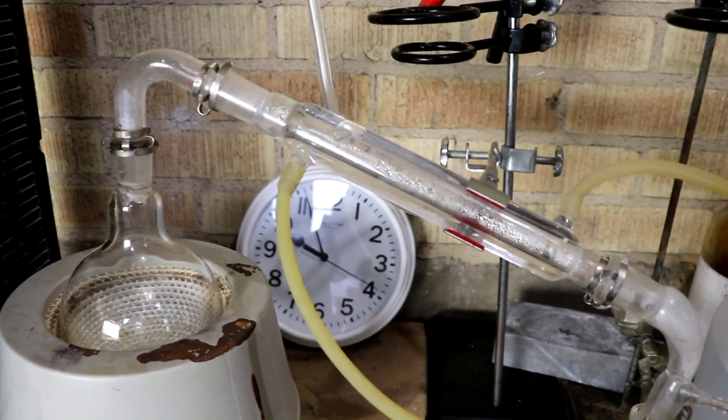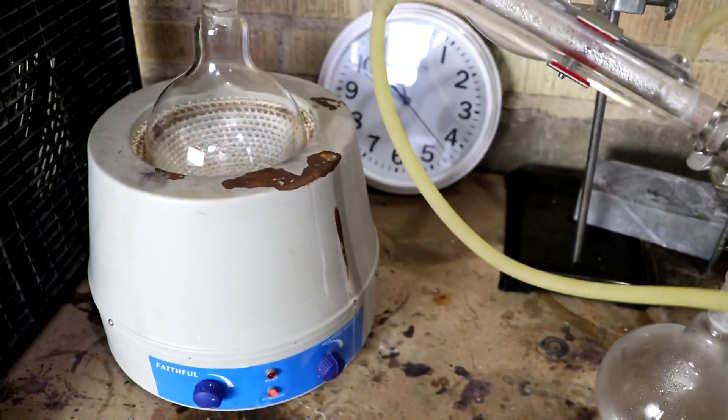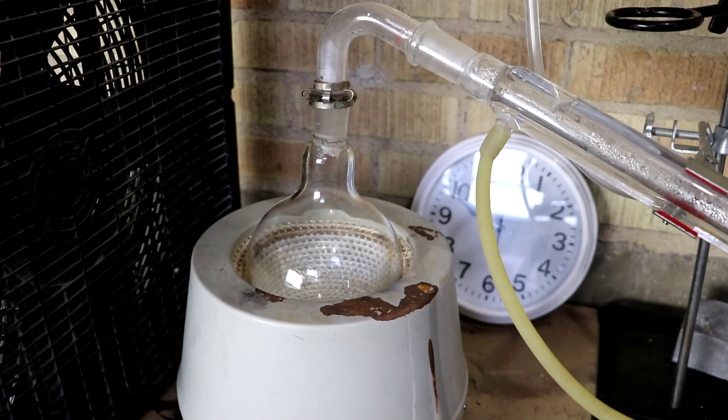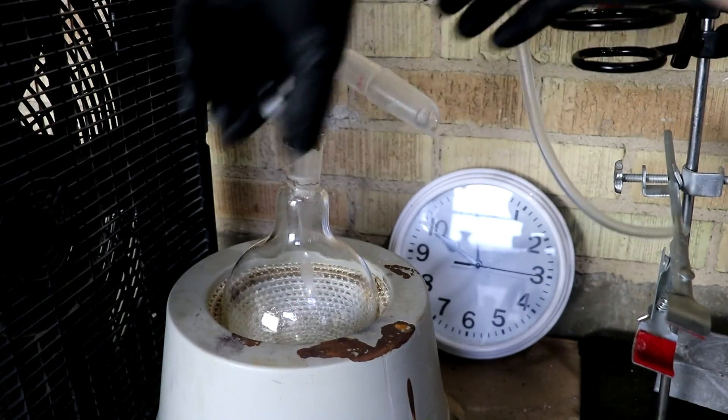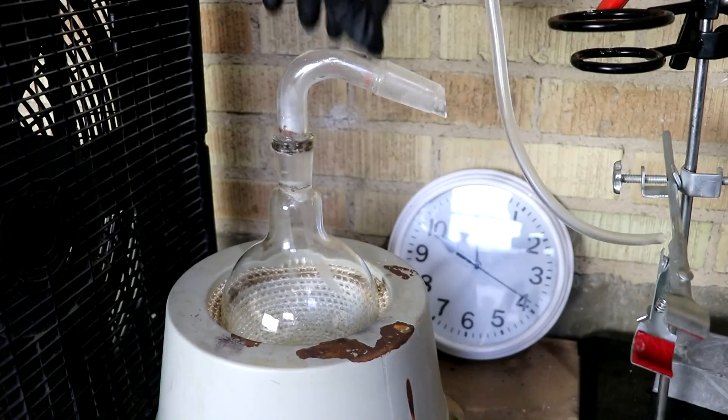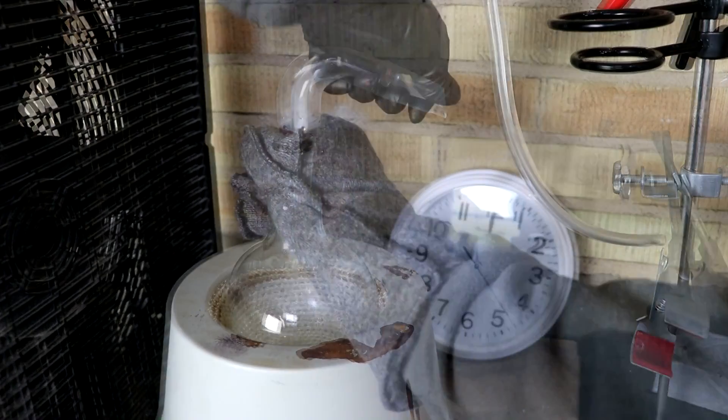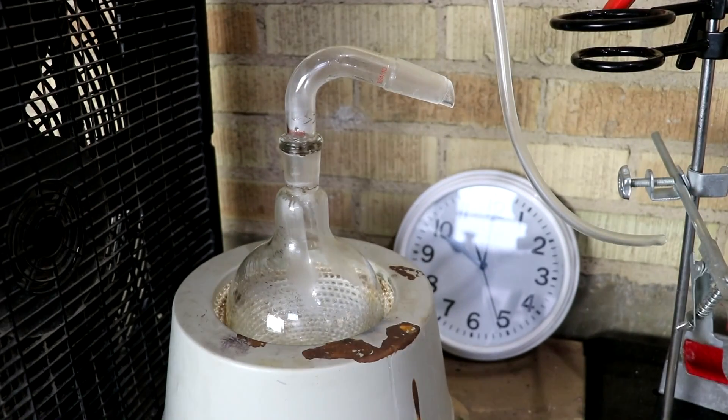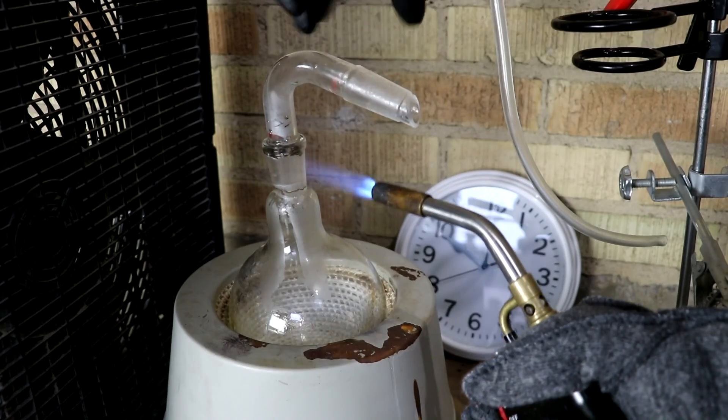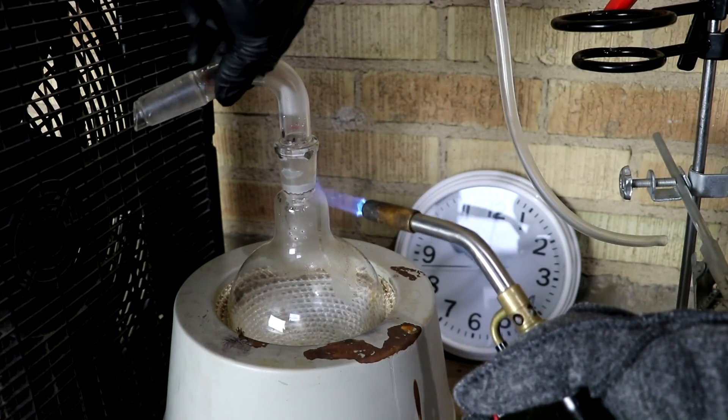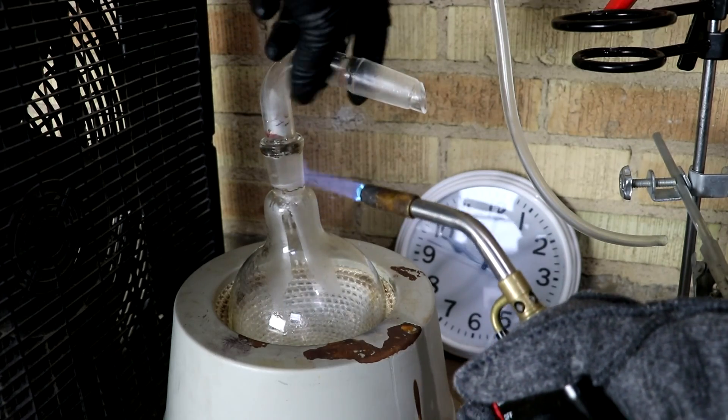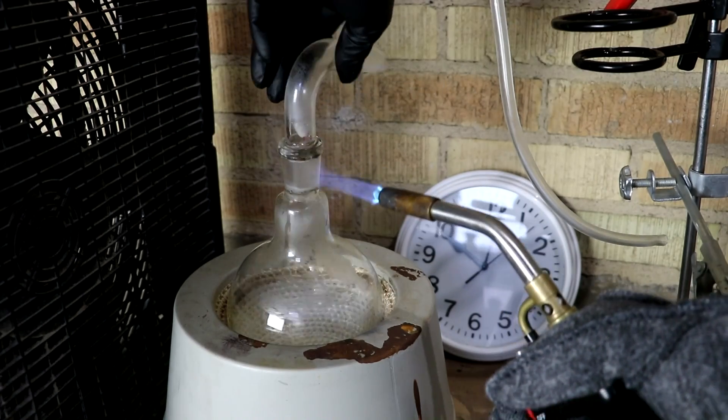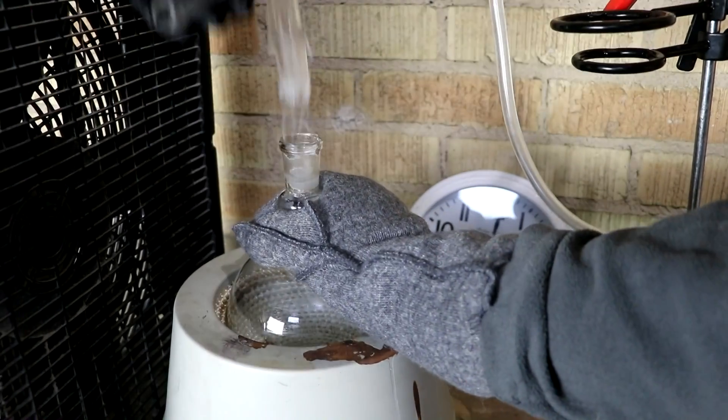Alright. I think most of the water has been boiled out. Let's pull it off there. Let's see what we got. Let's get this up. Oh, I think it's stuck. Even that happens. There we go.